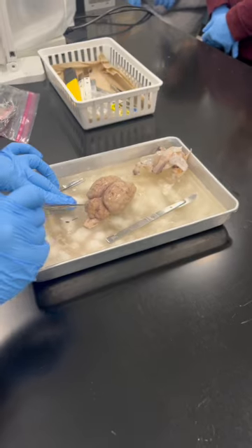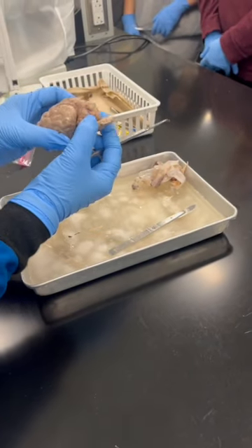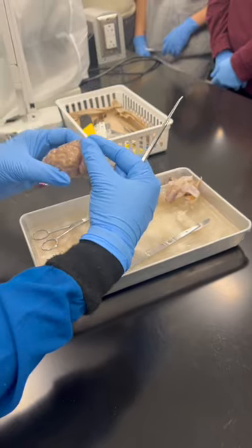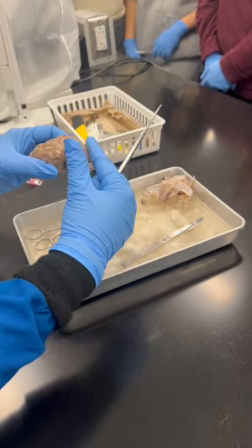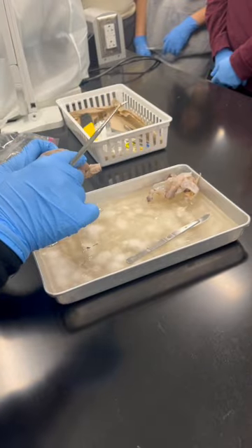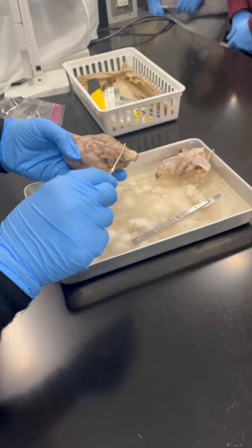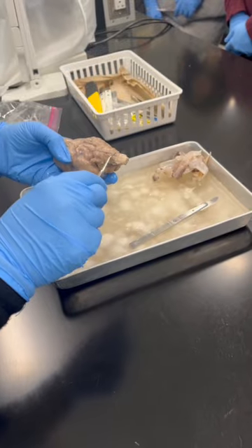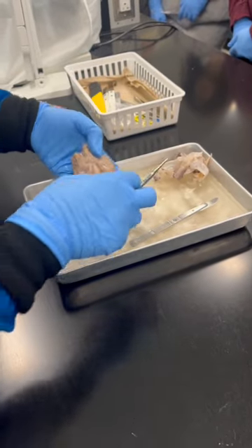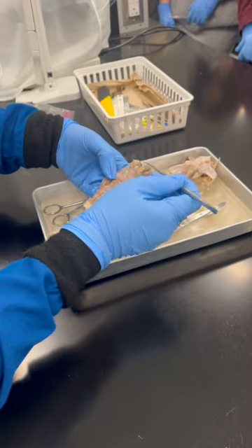So this one is the vermis. Over here, you see that the cerebellum has this portion. That's the vermis. In the picture you won't see this portion clearly. In the back you can see the pons, then you can see the medulla oblongata. What else can you see? Here, this is the olfactory bulb again.